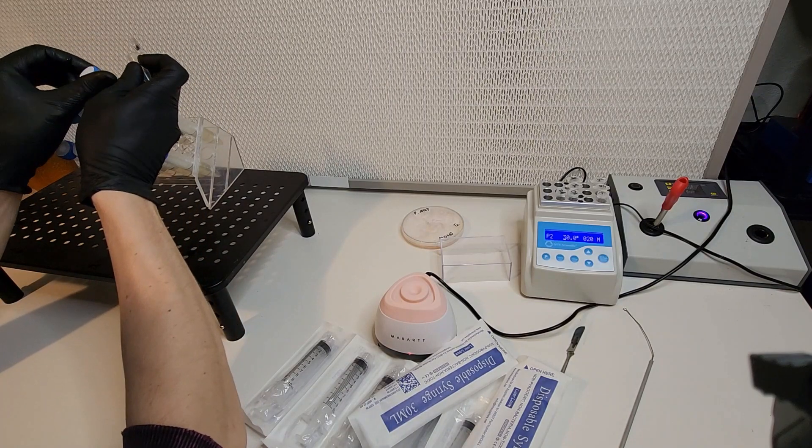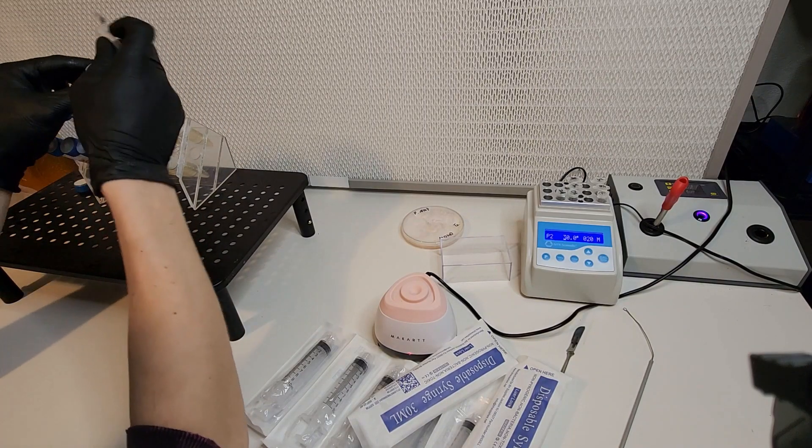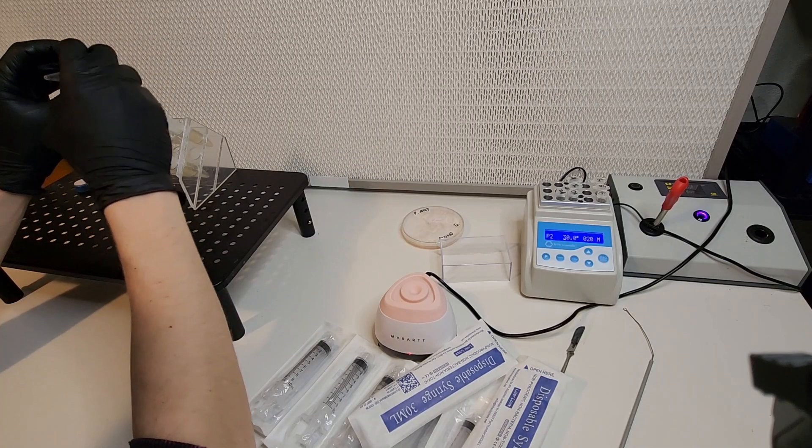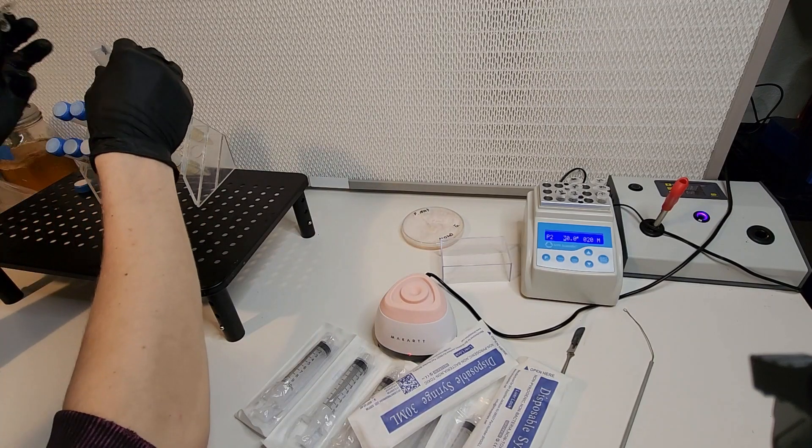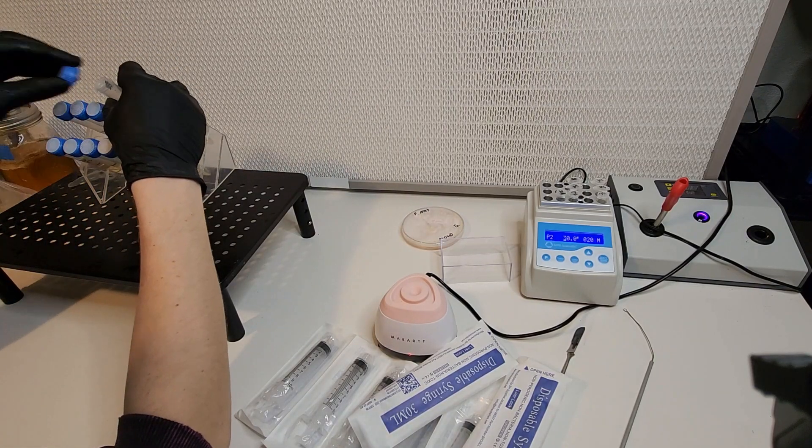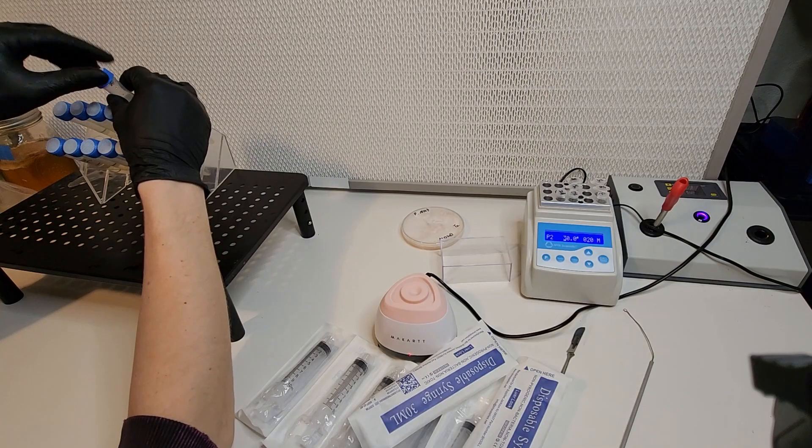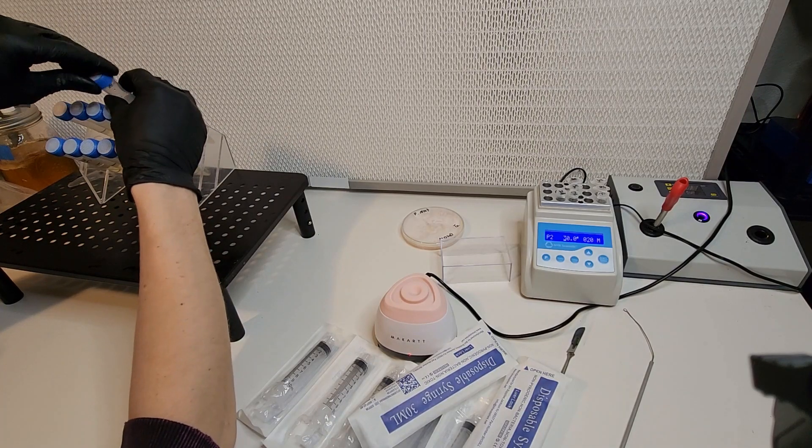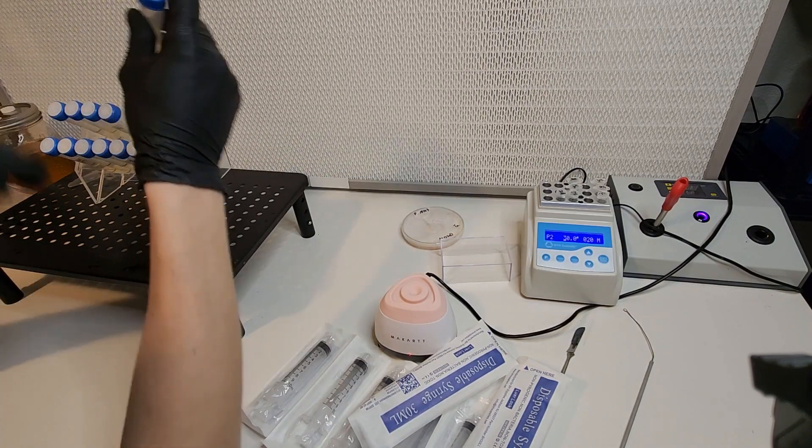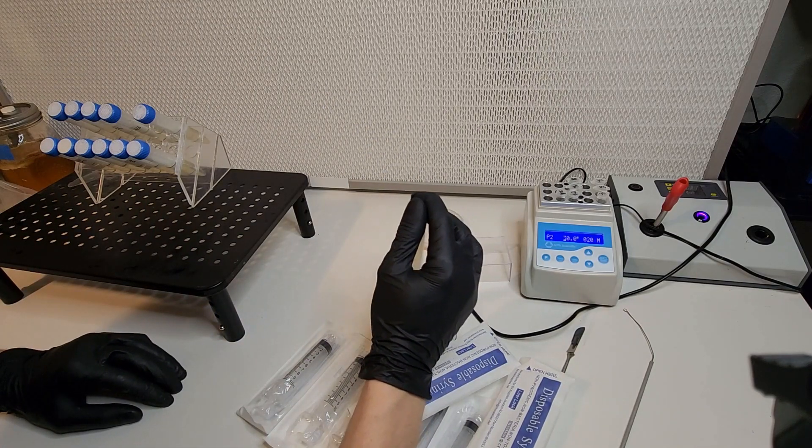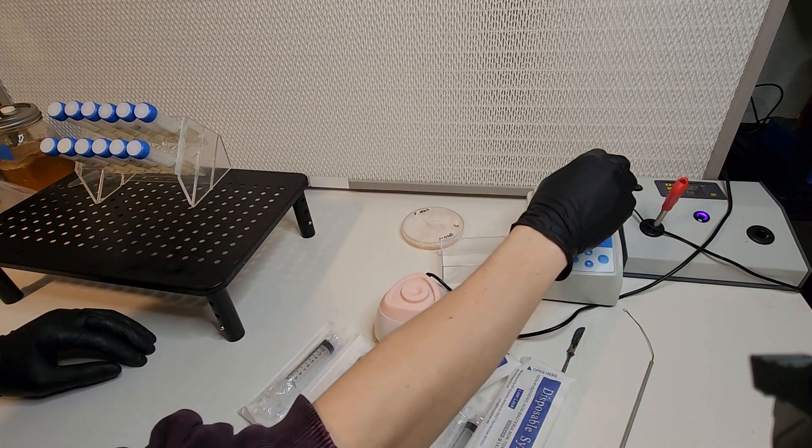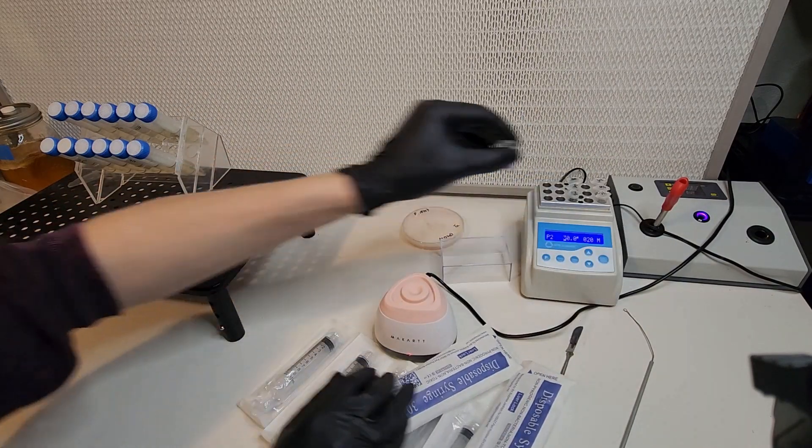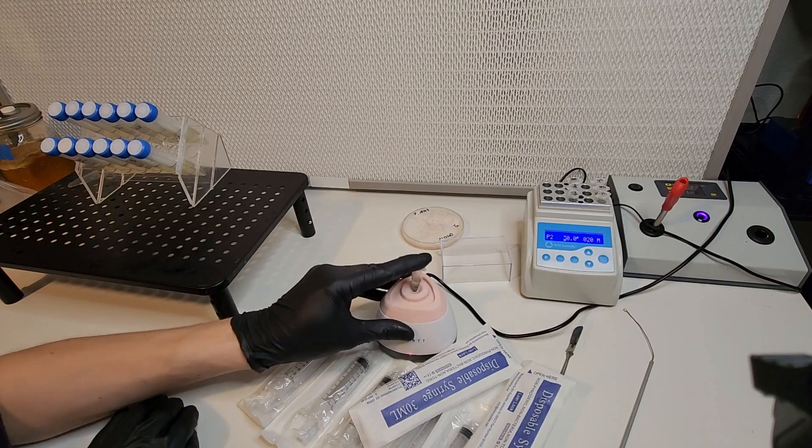I did this beforehand off camera, but you can do it before or after, and that's taking your syringe full of antibiotic liquid culture and placing five to six milliliters of that syringe worth of liquid culture into the bioreaction tube. That is the antibiotic liquid culture that your samples will then grow in and mature in and that the reaction will finalize.